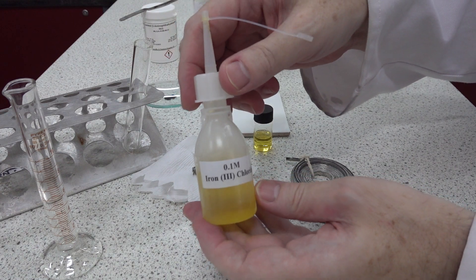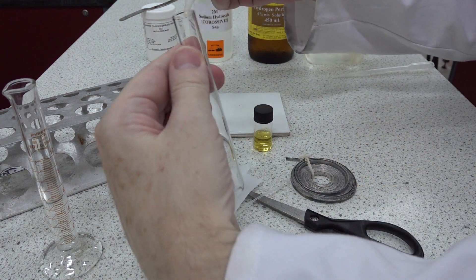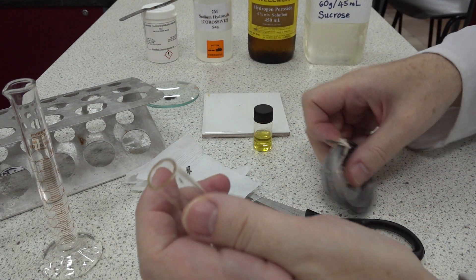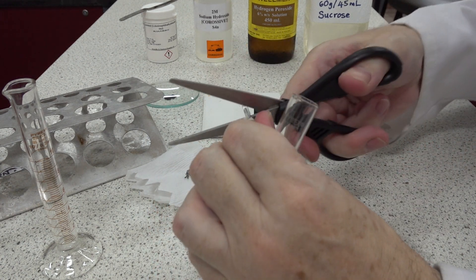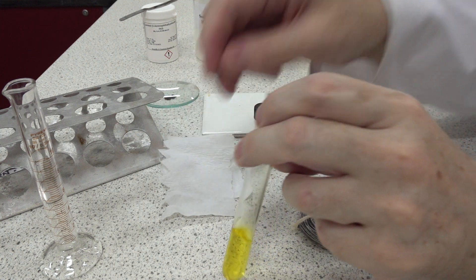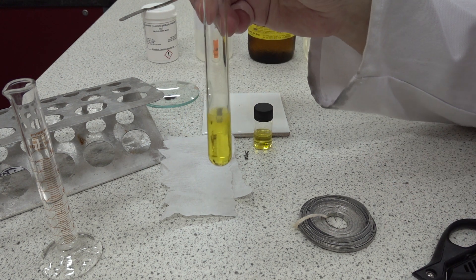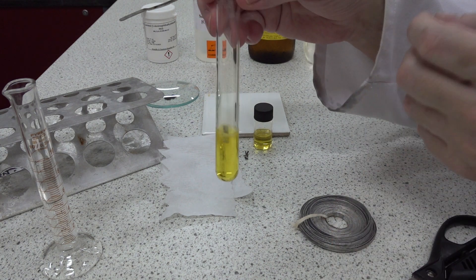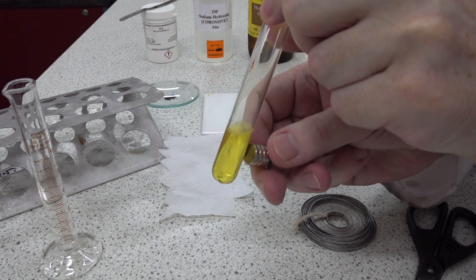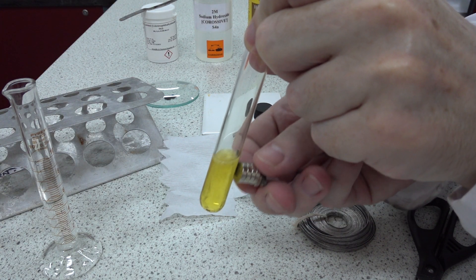First, let's take some 0.1 molar iron(III) chloride and add about a milliliter to a test tube. We then add a small piece of magnesium metal. The magnesium will react with the iron(III) chloride, which is acidic, so it fizzes — but a displacement reaction also occurs. You might like to think which metal is being deposited on the surface of the magnesium. If we take a strong neodymium magnet, you can see the magnesium is attracted to the magnet.